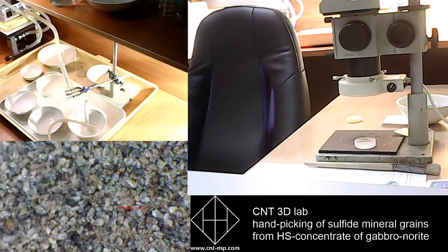So we will discuss how we analyze the EPD and the HS product, how we check the weight of each product, build histograms, graphics, and etc. Also, we are thinking about online seminars or webinars talking about analytic methods for which HS and EPD product fits better than any other sample preparation method.